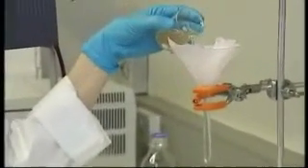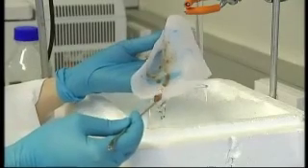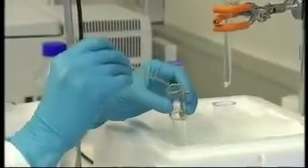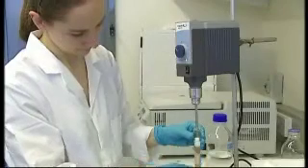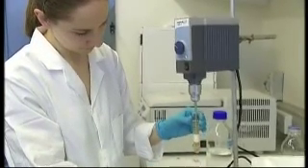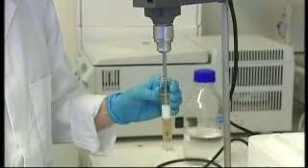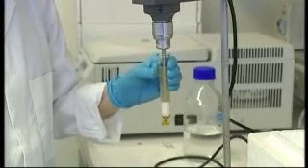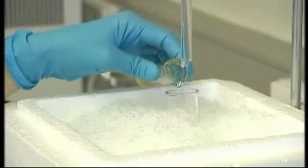Filter the suspension again through a nylon filter but in that case save the filtrate. Transfer the rest of the tissue into the homogenizer and homogenize for one more minute. Combine homogenate with filtrate in the centrifuge tube.